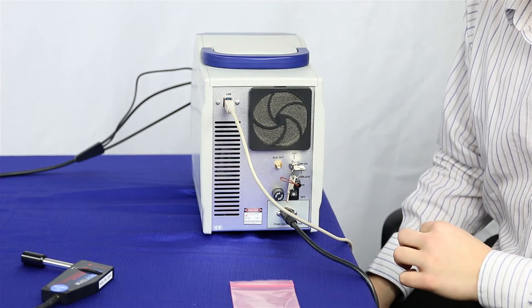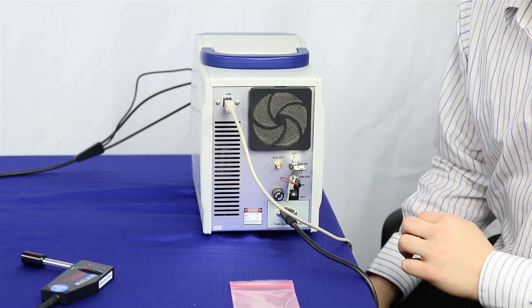Next step is plugging it into a computer and using it with the software.